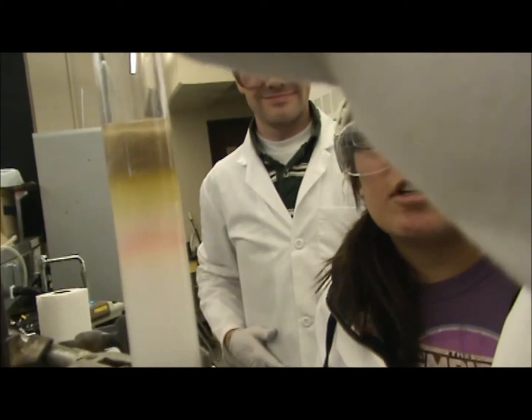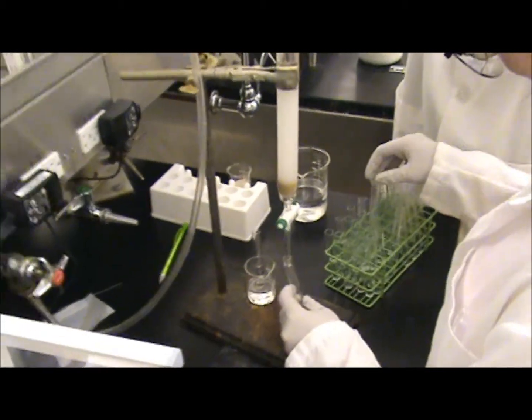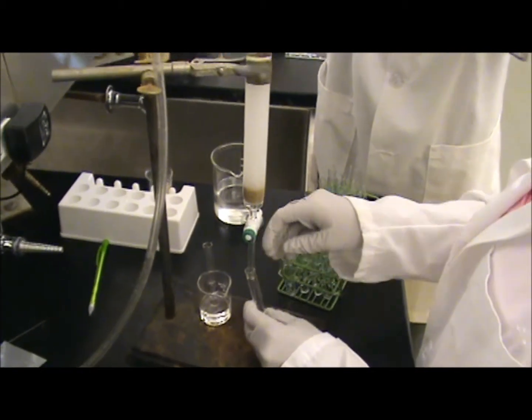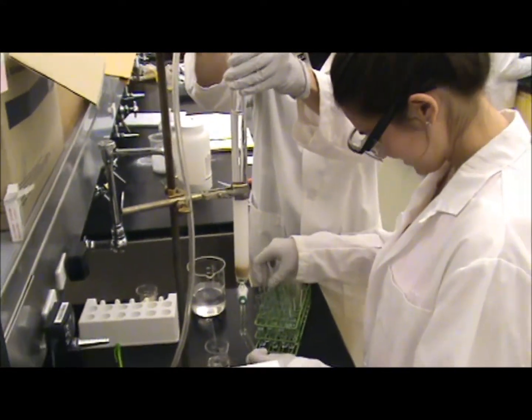Some cool pink stuff going on right here. Salt. Yeah. So we're doing a flash column on our hopefully final product, and we're just going to purify it by flash chromatography here.